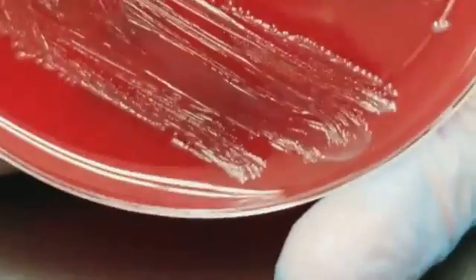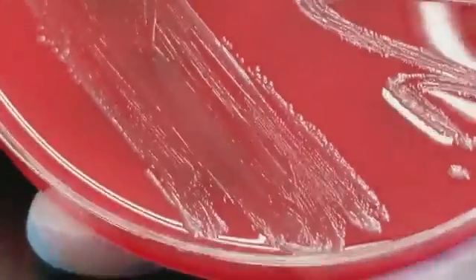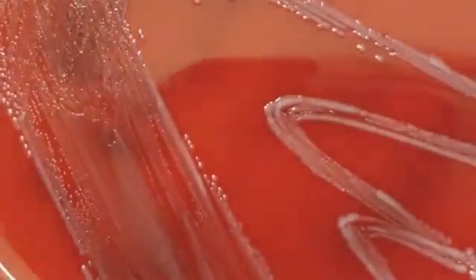This time, we're going to be looking at what pathogens actually look like. Unfortunately, these are not going to be cultures from an actual specimen with anything else that might have grown. This is actually purified cultures. So this is a pathogen from a urine, and just as we had talked about, this is actually Enterococcus faecalis.